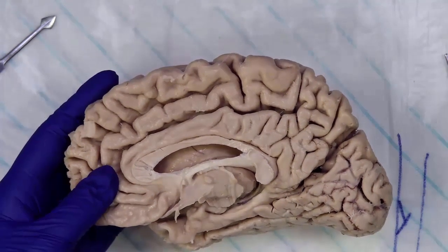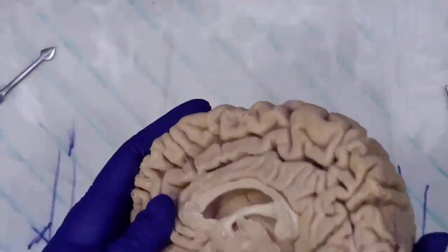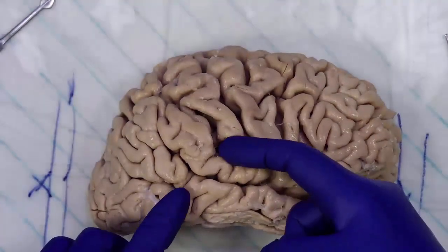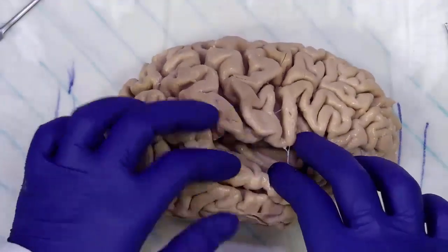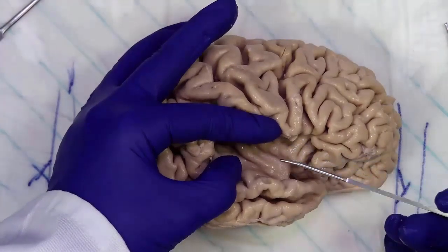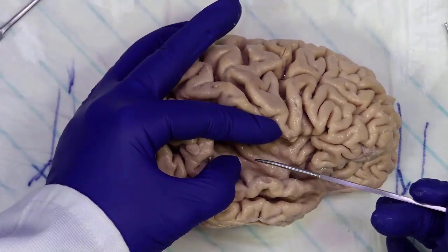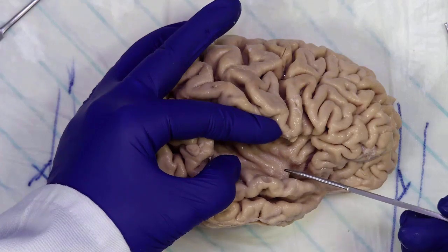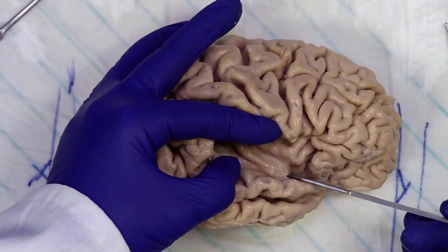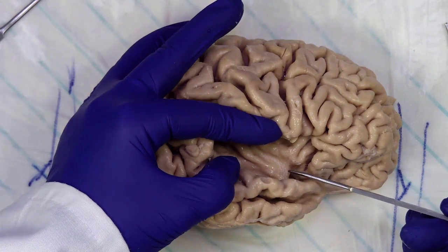Now we have to proceed to separate the temporal lobe. We are going to turn the brain and identify the lateral sulcus. We separate the lateral sulcus, and in the back bottom part we can identify the insula, the insular cortex. In the frontal part of the insular cortex, we can see the limit of the insula, or frontotemporal junction, and this is the important part because we are going to start to separate the temporal lobe here.